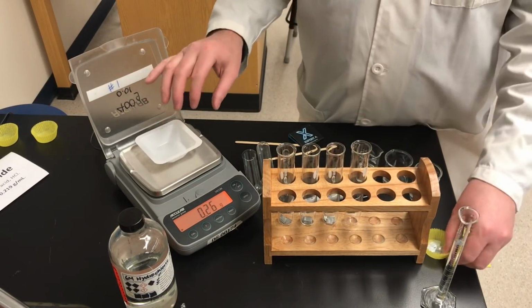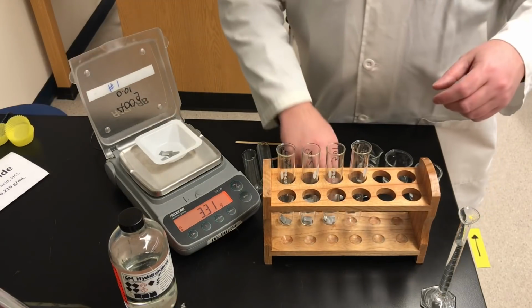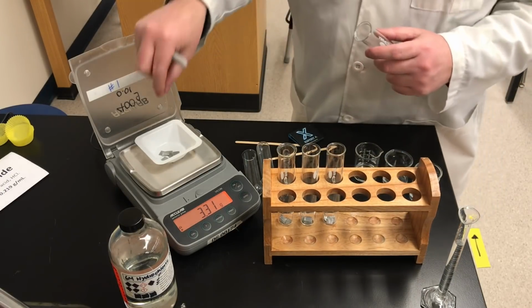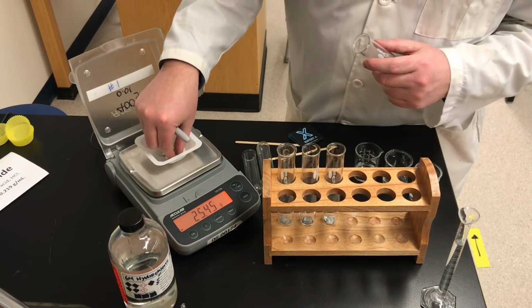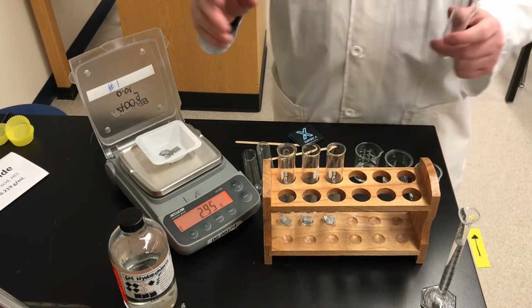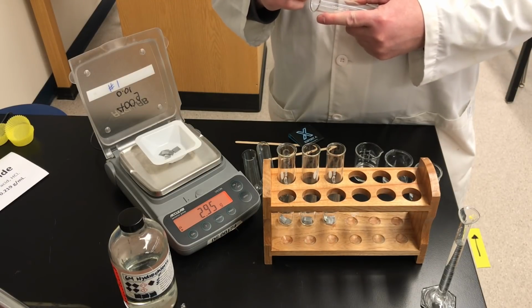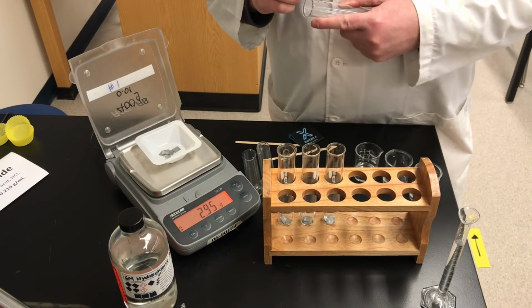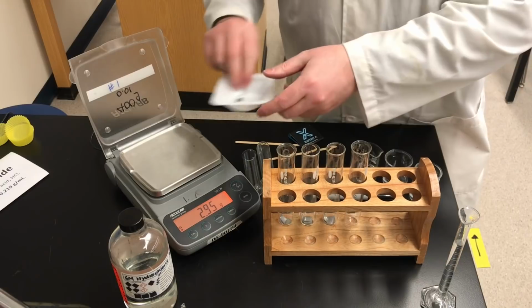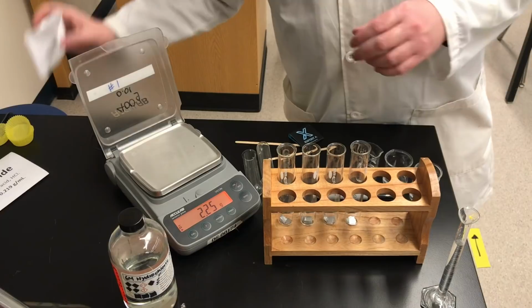And then our last sample. And let's record that final mass. You know what, that one's very similar to another sample, so I'm just going to change that slightly. You can change your mass, so there, we'll use that one. So all 4 samples are different. So there's the mass of our 4th sample. I'm reading these numbers upside down, so I have to be a little careful to copy them down correctly. So there's the zinc pieces added to all 4 test tubes.